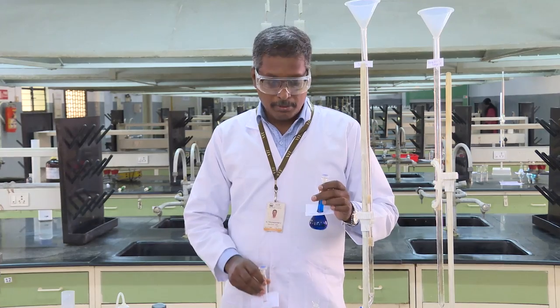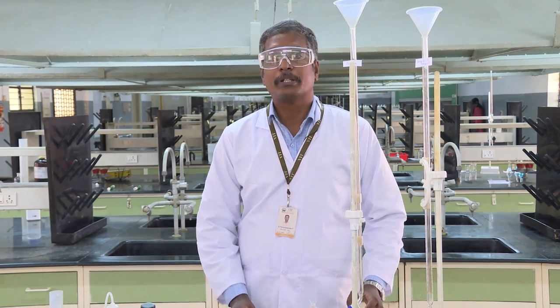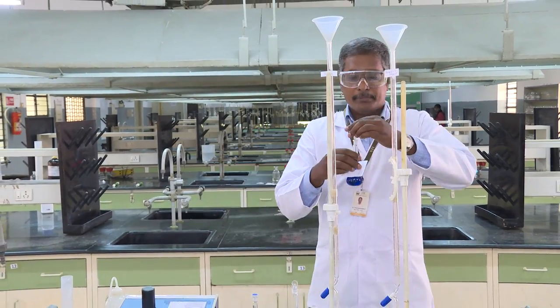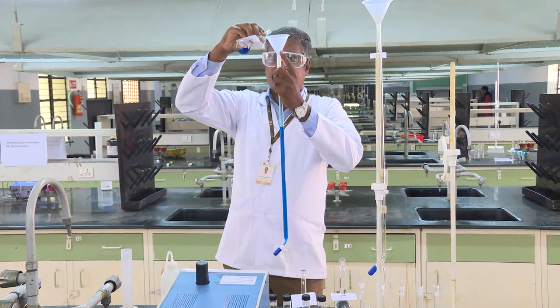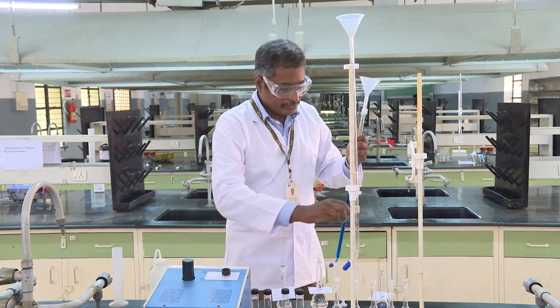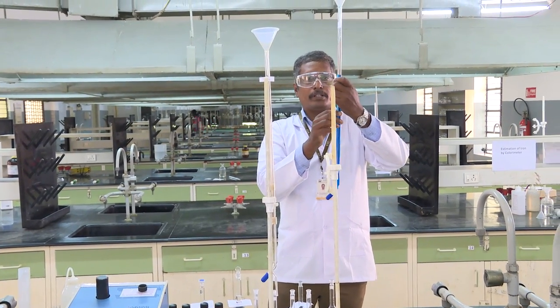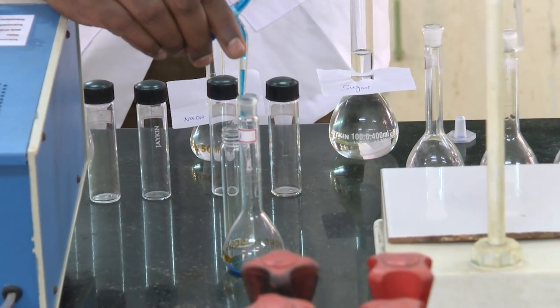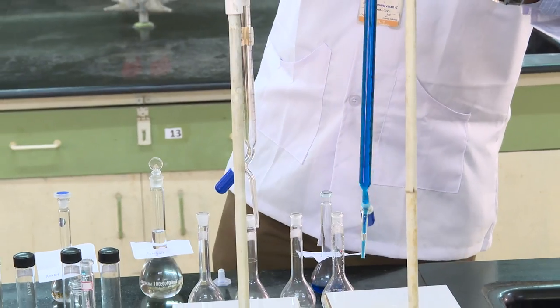We need to measure 0.5 ml of Benedict solution and then 4.5 ml of glucose, while the sodium hydroxide volume varies. Let us do sample 1 first — for that we use a burette. We fill the burette using a standard measuring volume of 0.5 ml Benedict, then add 4.5 ml of glucose.